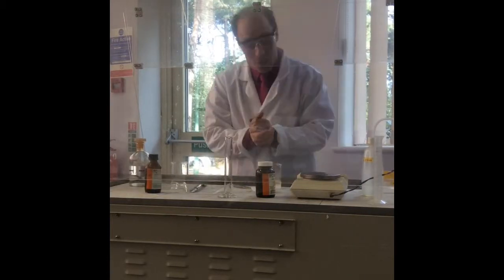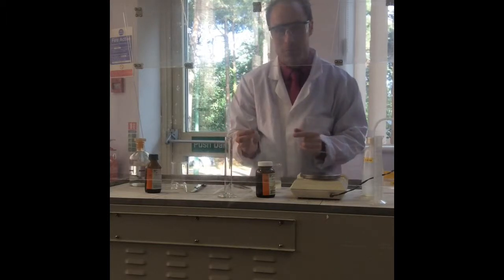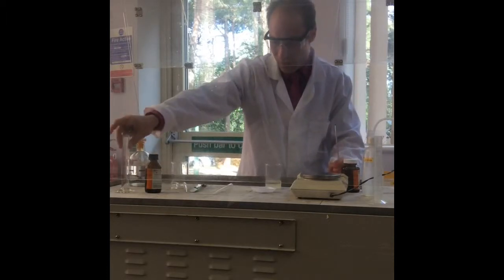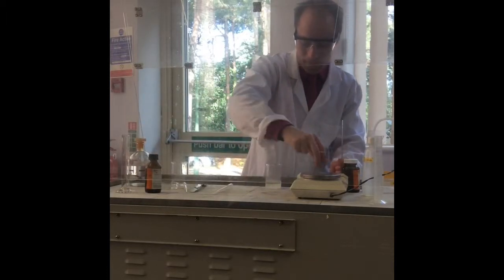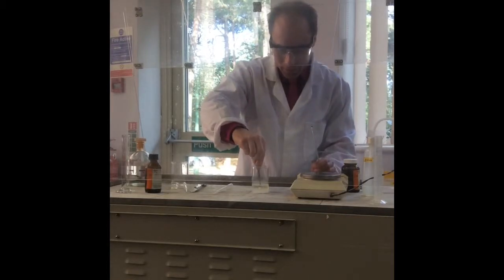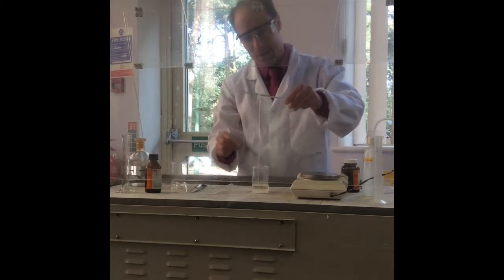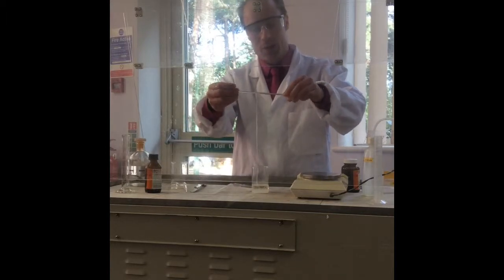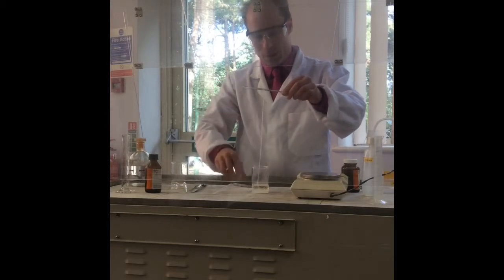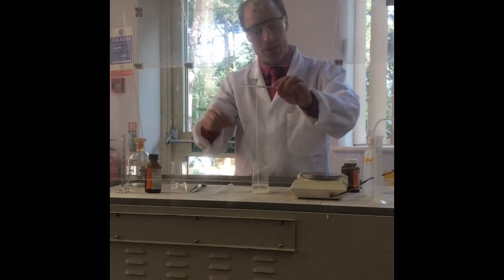So I've got to get that nylon out. I have got a rod, and I've got some tweezers. So let's try. It's like a spider web, isn't it? A little bit, yeah. So hopefully it's formed the nylon. And what I can do is I can run it. Why is it quite good to do it this way, rather than just mix it all up? Like a thread can be used for clothing. Yeah, absolutely. That's how we want it. We want it to be a nice thread, don't we?